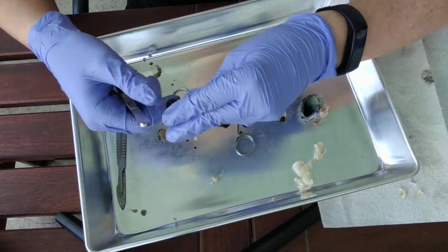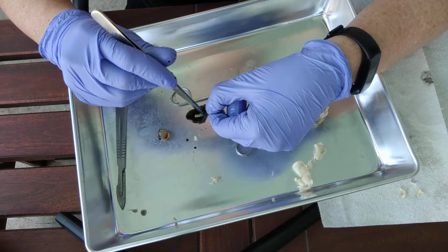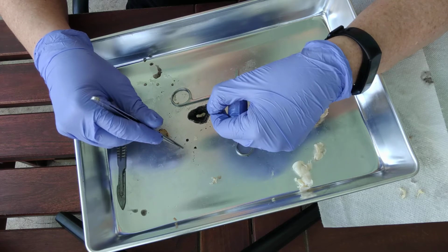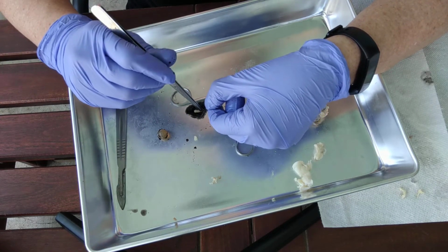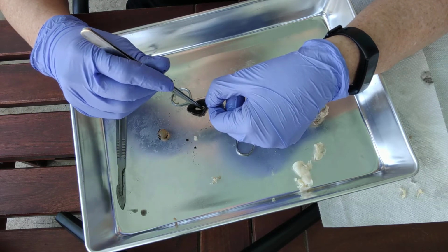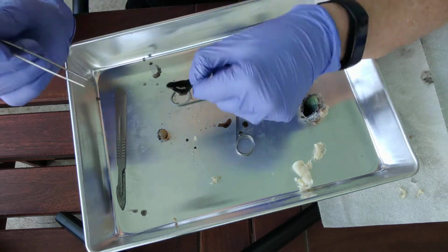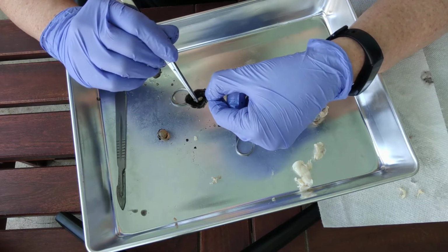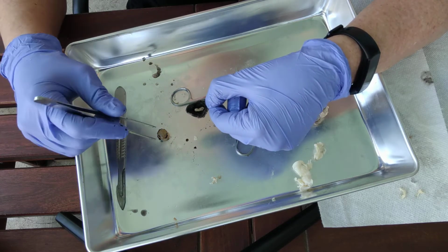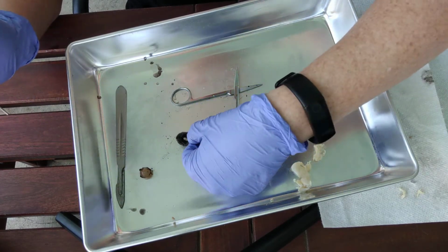Now, one thing that's very interesting is to look at the shape of the pupil. Okay, so again, a pupil's not a structure, it's a hole. It's a hole in the iris. For humans, the pupil is going to be round, and for sheep, it is a slit, like elongated. So that hole would be the pupil. On the other side, you can see the other side of the cornea, which is that right there. The flap is going to be the iris, and the mushroom-like thing is going to be the ciliary body, which will attach to the lens, which is this marble structure here.